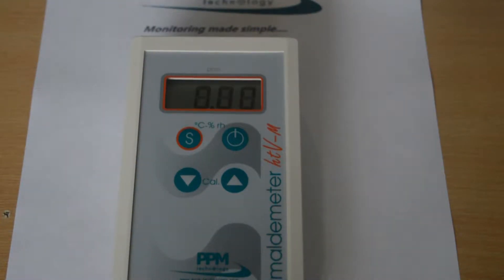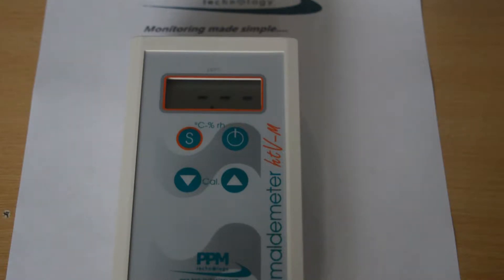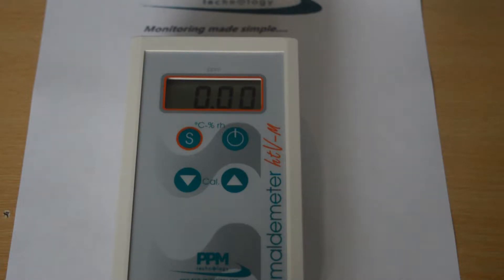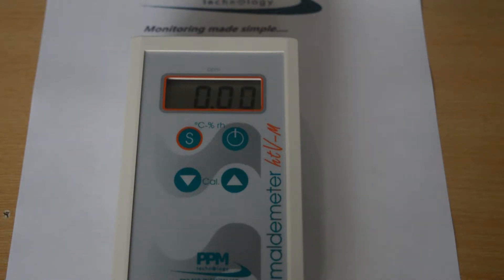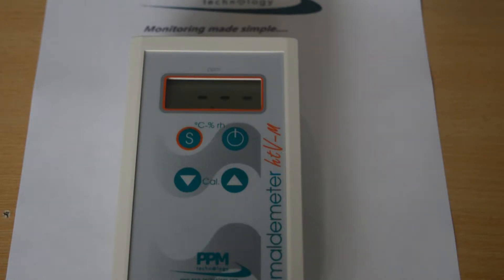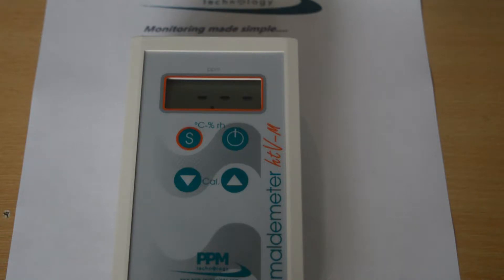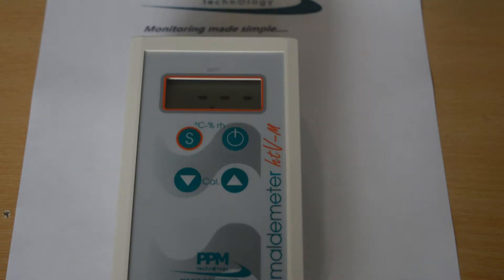As it is analysing the sample, the display will change from 3 dashes to 0.00 and back again for around 60 seconds, after which the display will show a steady value. It is important to bear in mind that this amount of time may vary depending on the specifications of the customer or supplier.